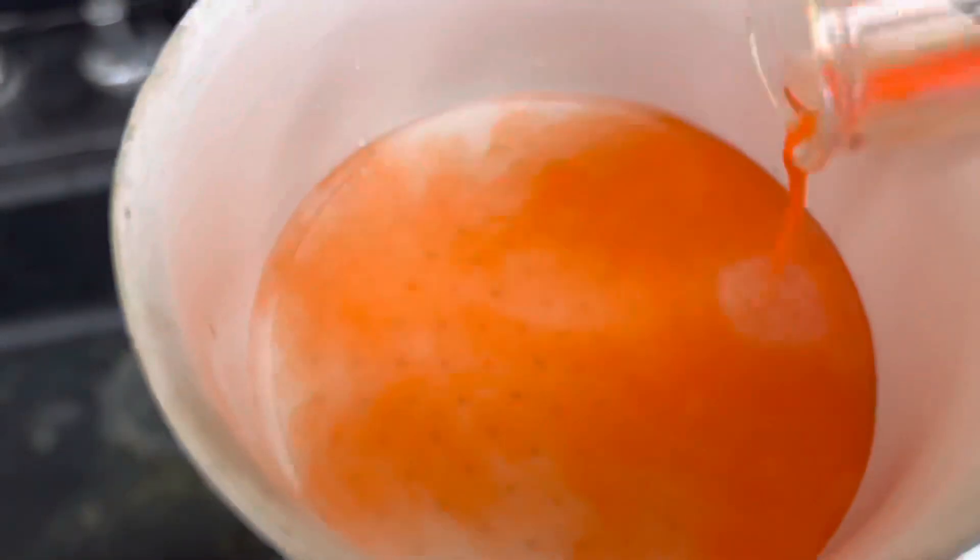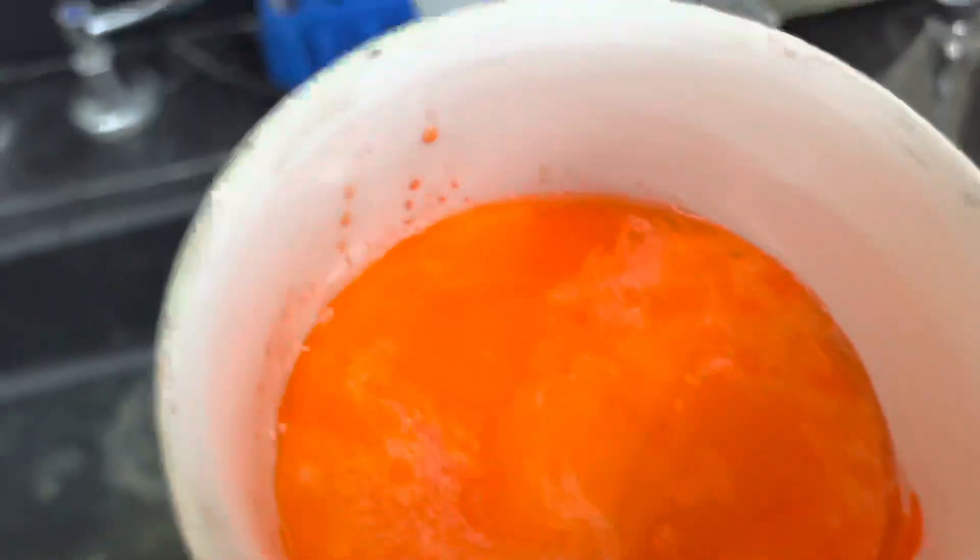And then I'm going to pour the rest of my mercury iodide into my filter. And then I'm just going to turn on the vacuum pump.